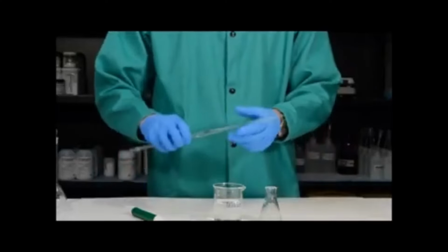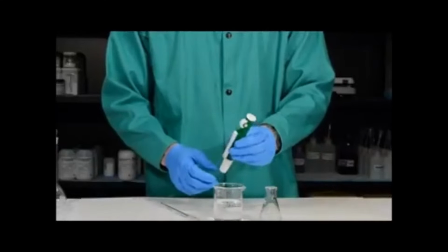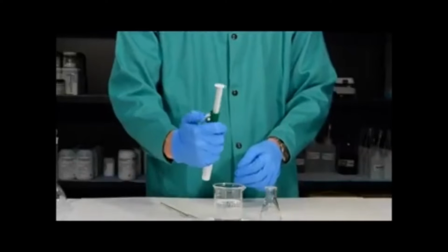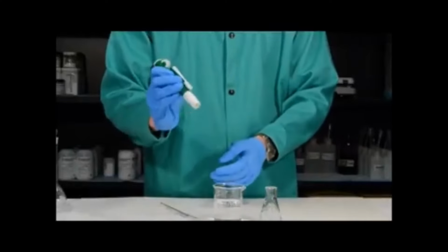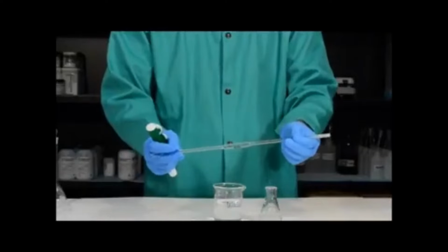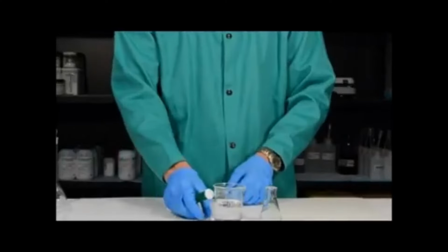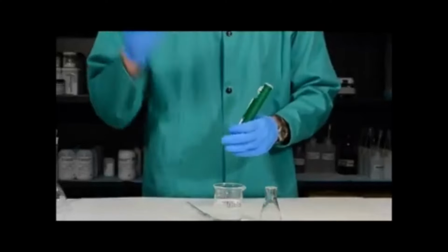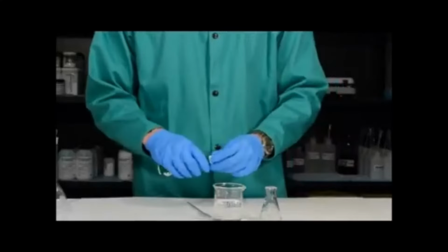In order to use a 5 milliliter volumetric pipette, you're going to need to use a pipette pump. A pipette pump is designed to draw liquid into a pipette. This is done by simply scrolling the wheel and sucking the water up into the pipette. In an ideal world, you can use the pipette pump to exactly fill the volumetric pipette with 5 milliliters of liquid. However, it's very rare that these actually work exactly as planned. So it's much better to actually draw in more liquid than you need and then drop the volume of the liquid until you have exactly 5 milliliters. And I will demonstrate that for you now.